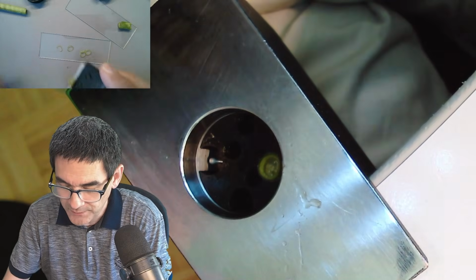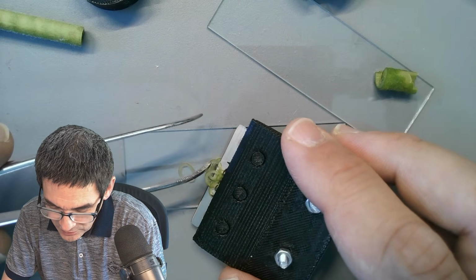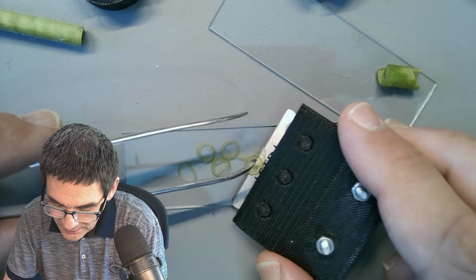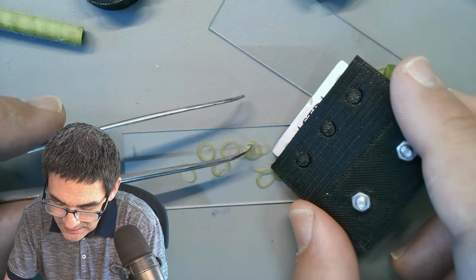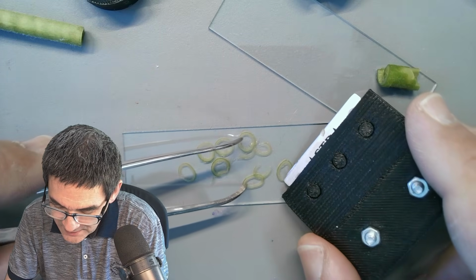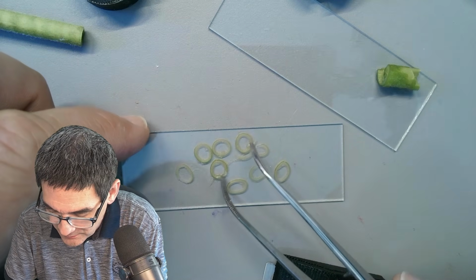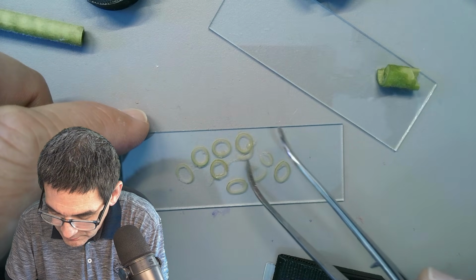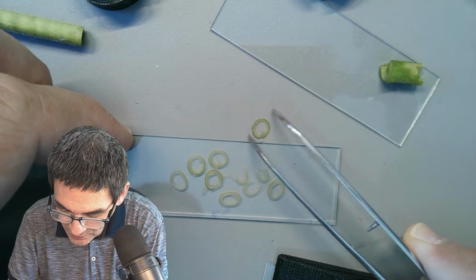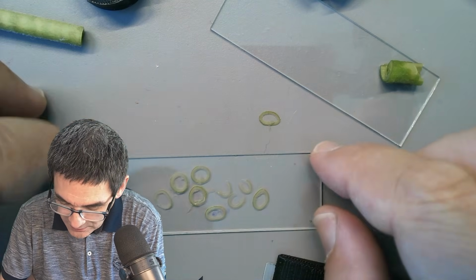Okay, so I'm going to just put it on the slide, and I'm going to simply put a pretty large cover glass on top, to check how well the cross sections actually worked. I do have also very large cover glasses, but the first impression is that these cross sections are not the thinnest, but this doesn't matter. Well, you know what? I'm going to remove the thicker one here, because I do want the slide to be fairly flat. So let's give it a try.